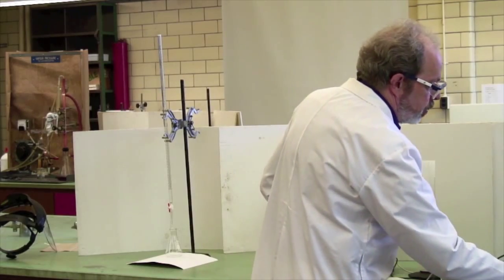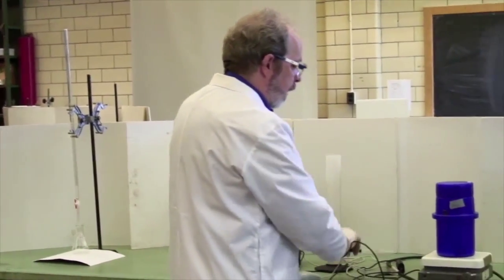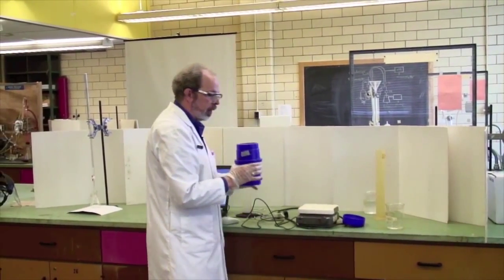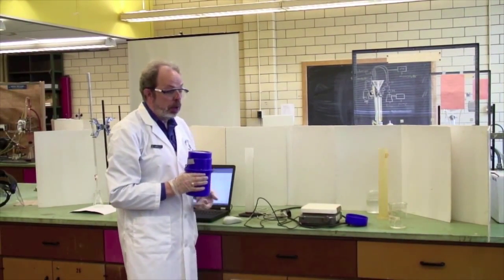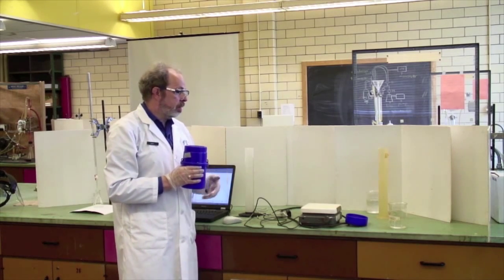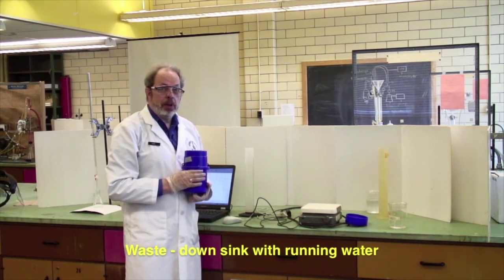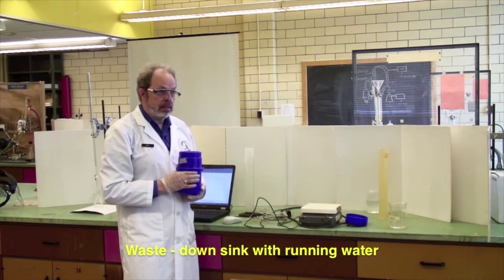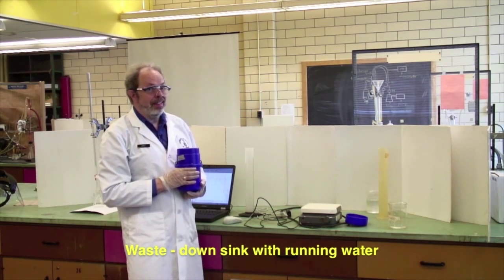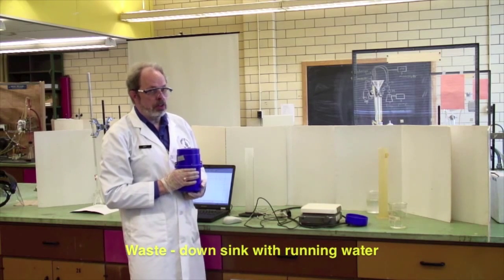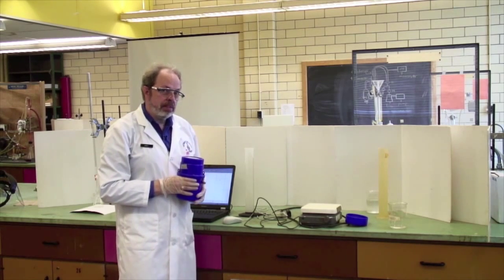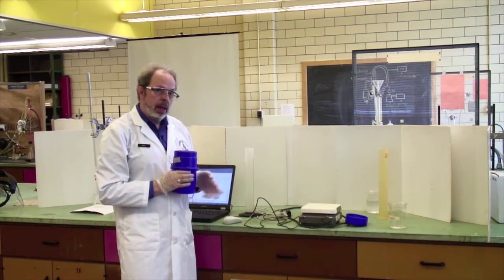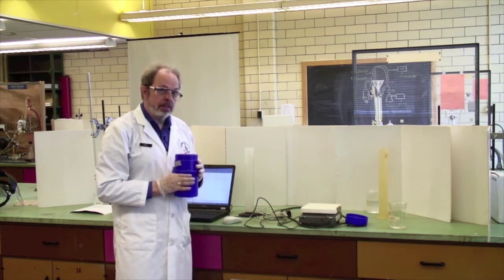At this point, turn the heater off. Take this out. The waste from this particular experiment can be just thrown down the sink. This is only water. But when you're mixing the sodium hydroxide and acid, which will be either HCl or acetic acid, all you're producing is slightly salty water. So again, the waste from this experiment can go down the sink with running water. Let's prepare that and get ready for an acid-solid reaction.